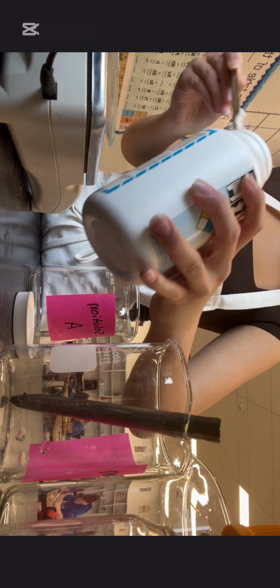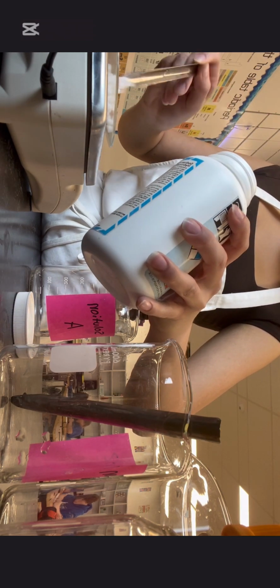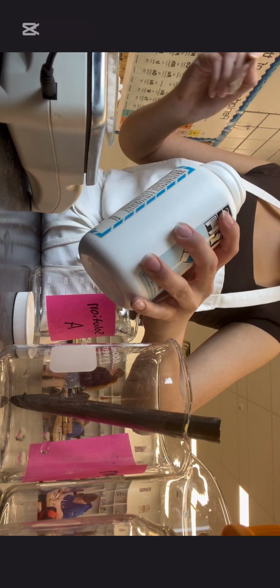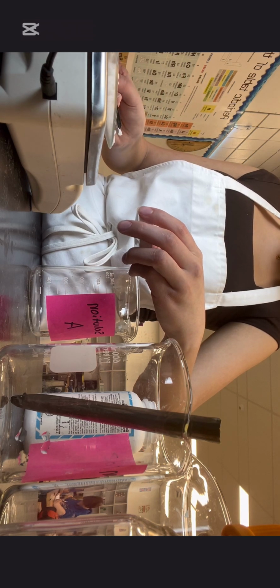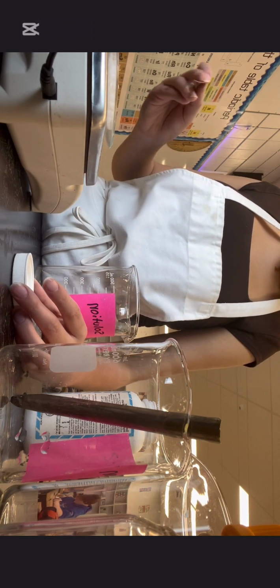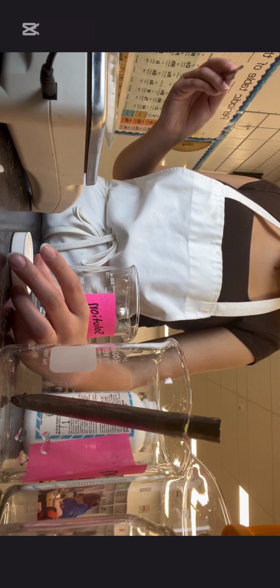So what really is happening during this reaction is, first, the oxygen in the air oxidizes the blue solution that is colored by the indigo carmine into a green color, the color of its oxidized form. As soon as I add the blue indigo carmine solution into our solution of solution A and B, it turns green. The glucose in solution B starts to reduce the indigo carmine, and that's when the green solution, left to stand, turns first red and then yellow. The indigo carmine is fully reduced once the solution turns yellow.